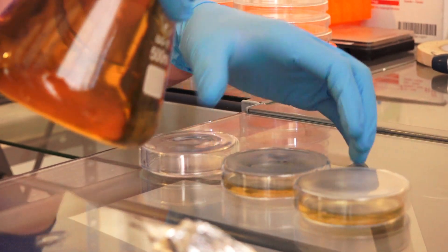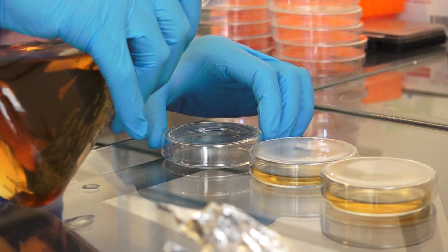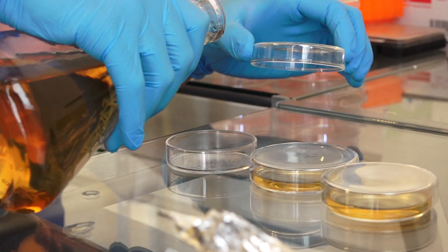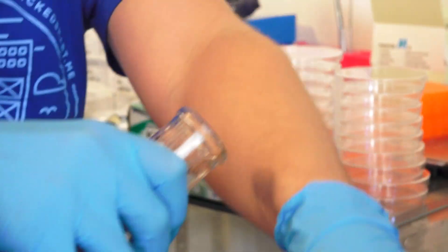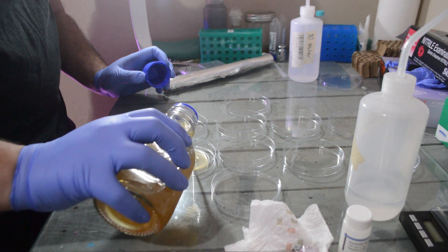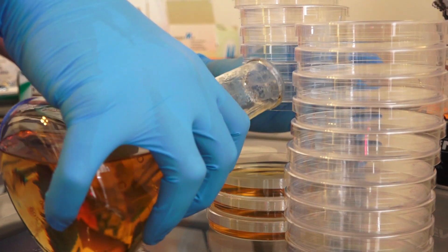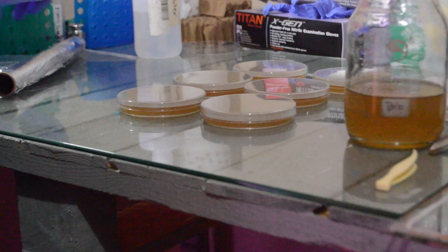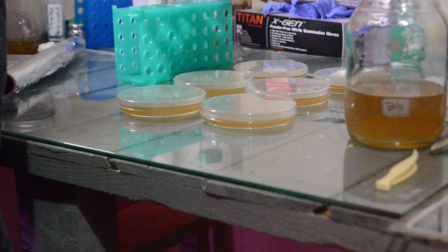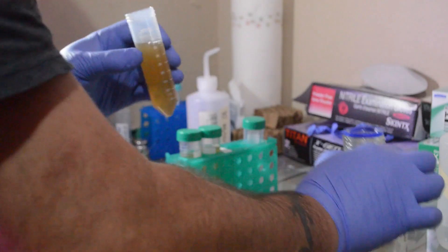With that set up we can finally start to pour the plates. Proper technique is to only lift the lid off the petri dish as much as necessary and pour in enough media to fill the dish with no exposed spots — usually about one half to three quarters of the way up. Once you've got the hang of it you can get a stack of plates and by lifting the whole stack, pour into the lower plates and work your way up. Now the plates are left undisturbed until they fully set. This procedure is the same regardless of what kind of agar you're using.